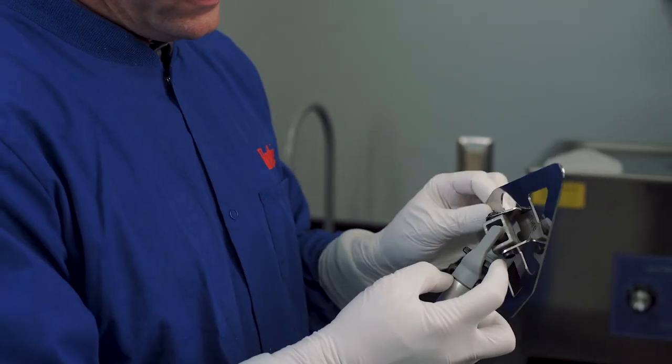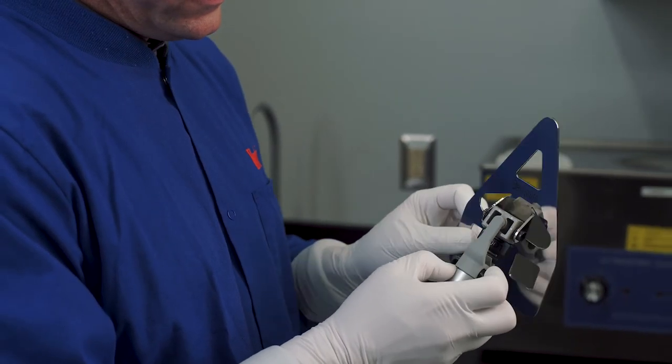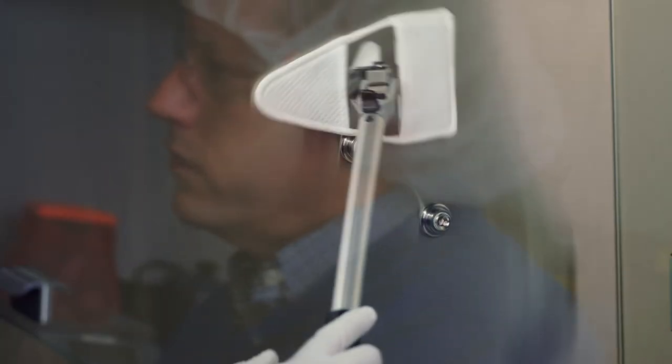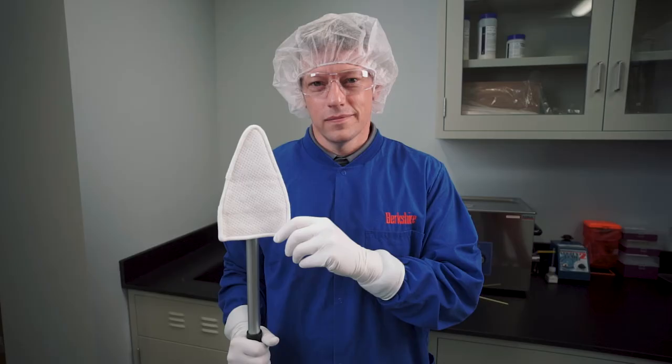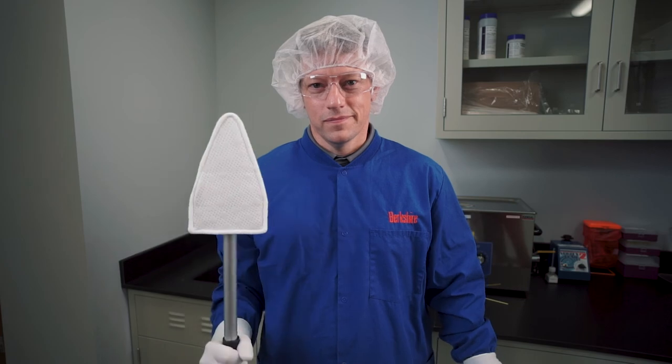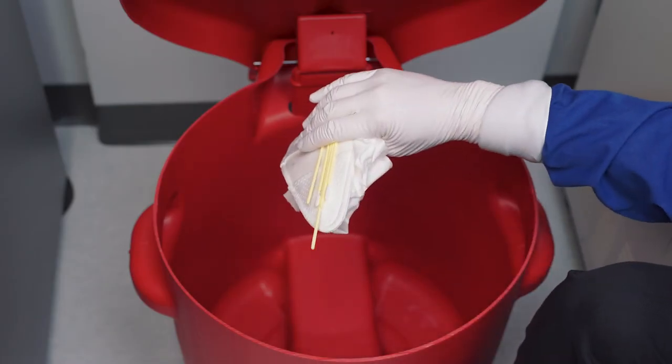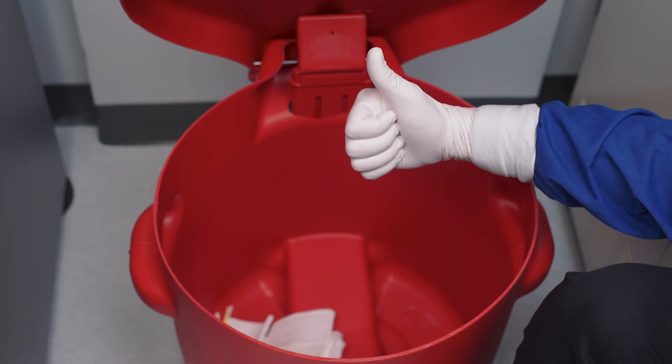Lock and unlock the 360-degree feature as needed for proper head angle and reach. Change padded cover for each section. Place the used covers, wipes, and swabs in an approved waste container.